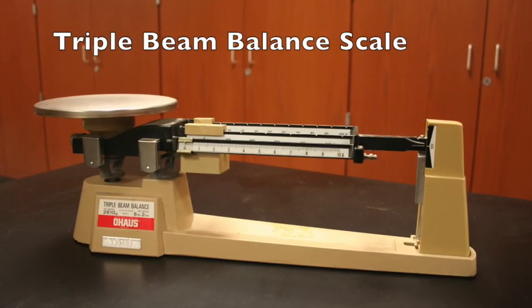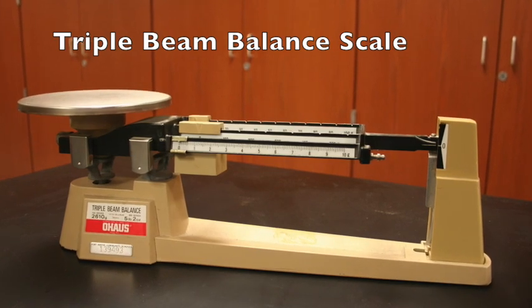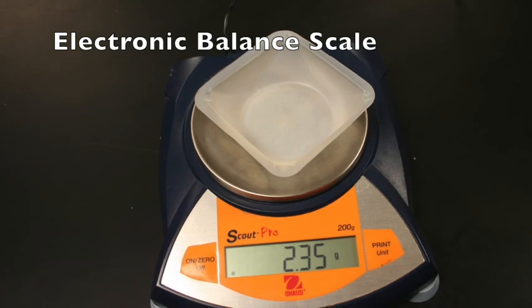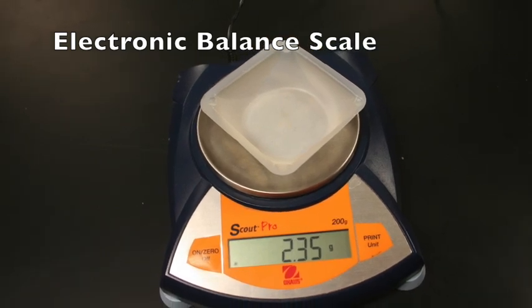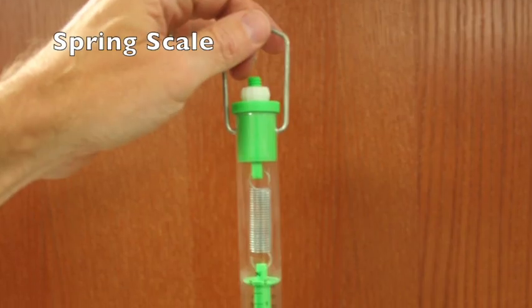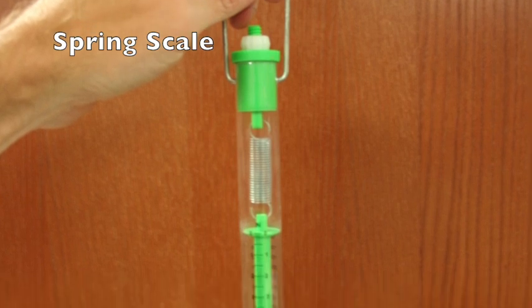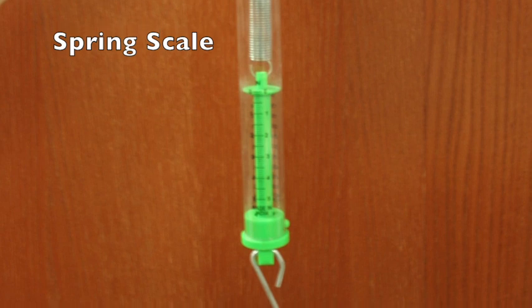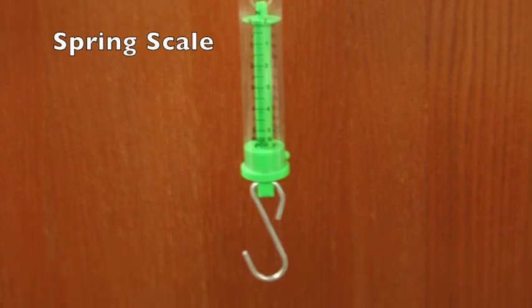The property of mass is the amount of matter in an object. It is measured using the balance scale. The triple beam balance or the electronic balance may be used. Weight, or any other type of force, may be measured using a spring scale. These tools of measurement will be discussed in greater detail in another video.